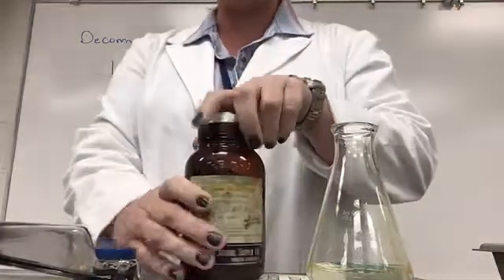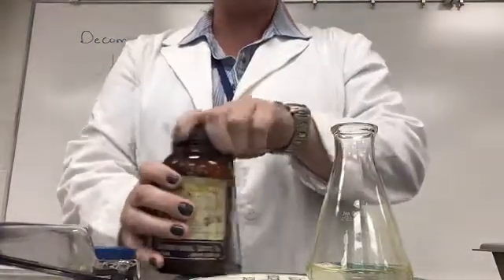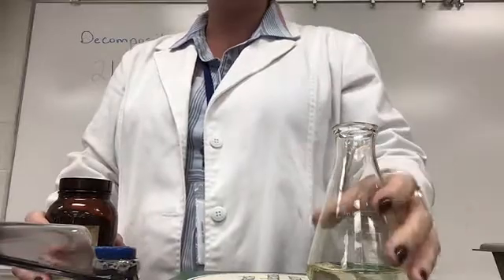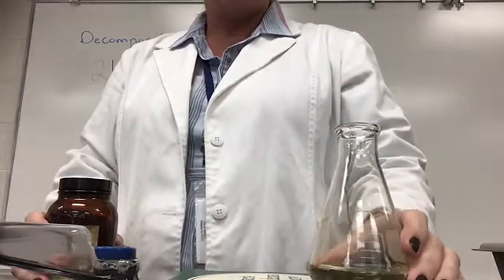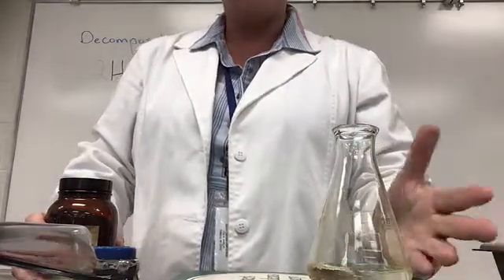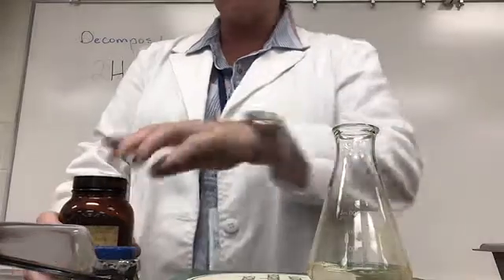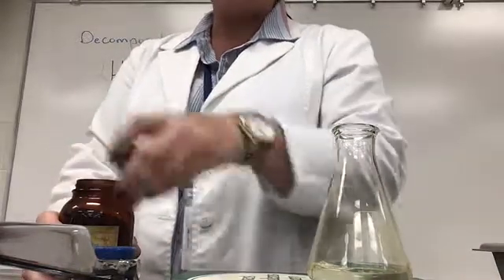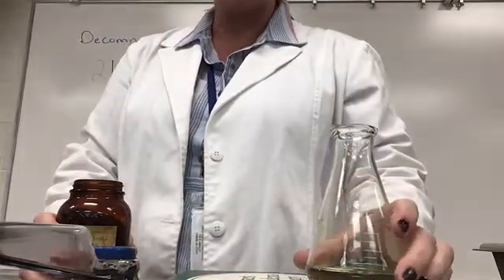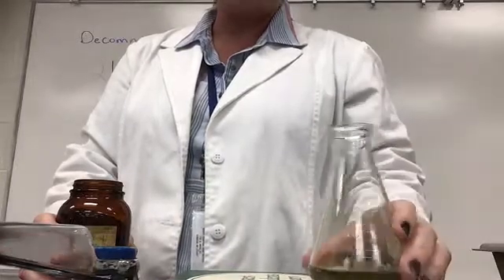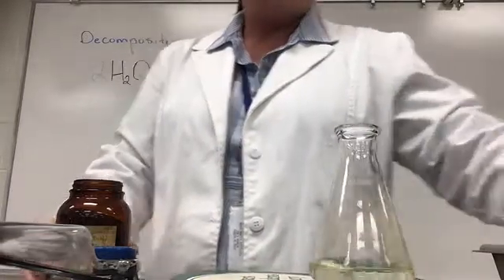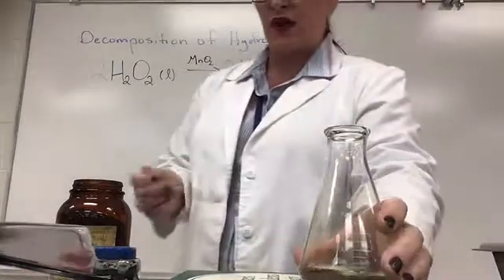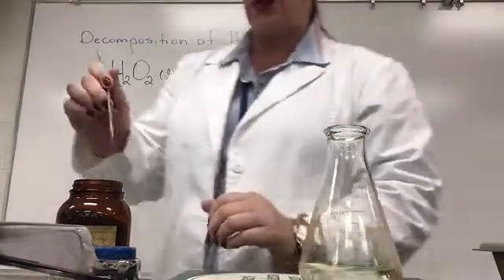And this is my manganese dioxide catalyst. And if I just left this here open to the air like this, it would probably take about 30 days to 50 days, and it would decompose. And all I would have left in here would be the water. So even if my water didn't evaporate away, I would no longer have hydrogen peroxide. It will eventually decompose into water.